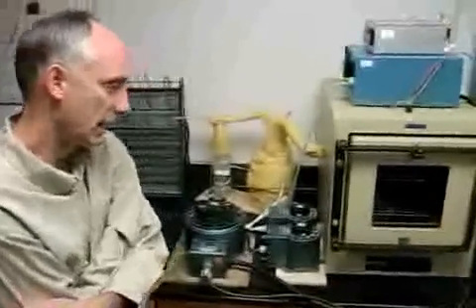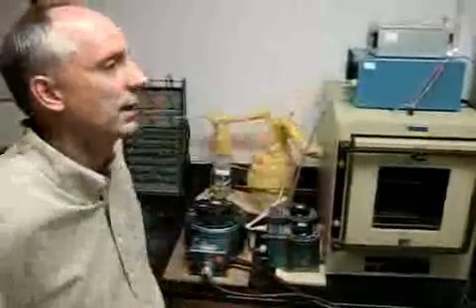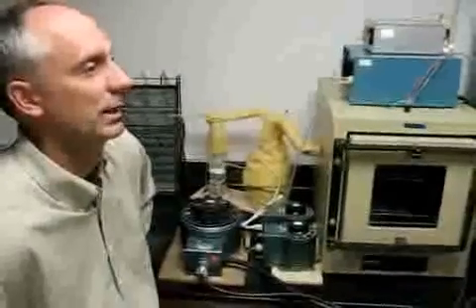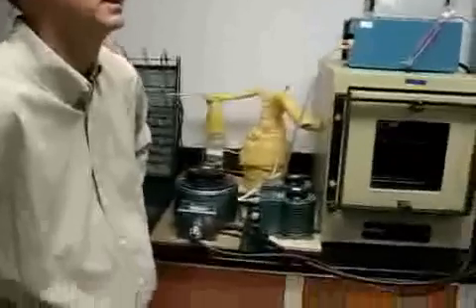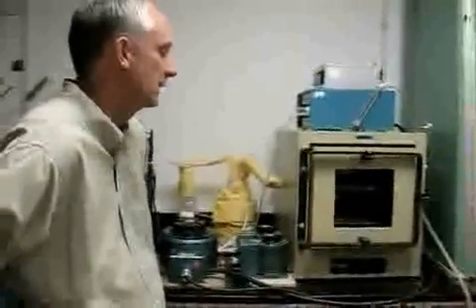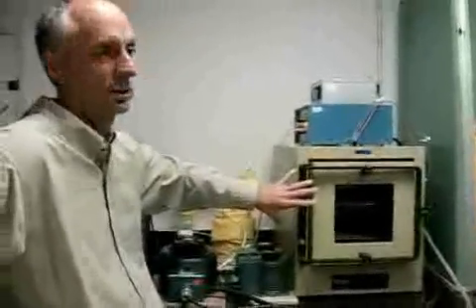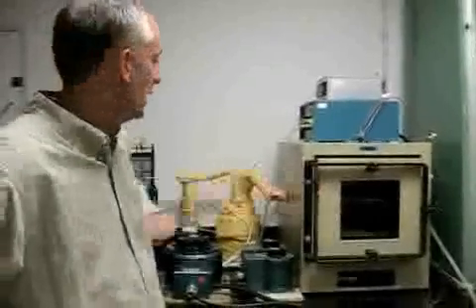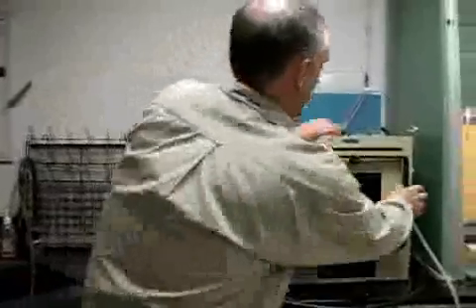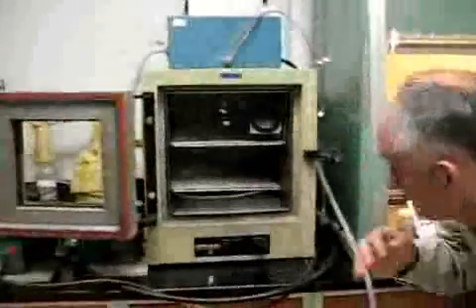The flow rates that we're using, if we assume an exponential dilution of the volume of air in the incubator, which I believe when it's full of the samples and bottles we've calculated to be about 45 liters, give a 95% air exchange every 10 to 15 minutes. We have a fan within the oven, as well as the distribution hose.